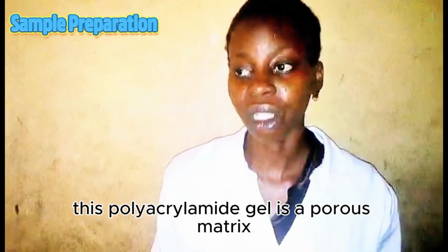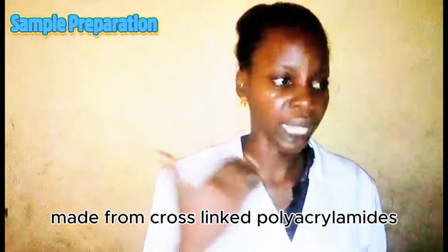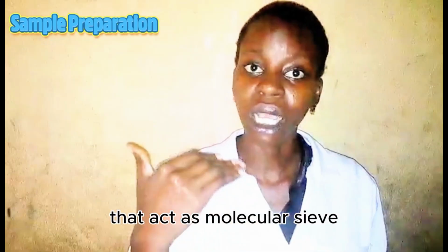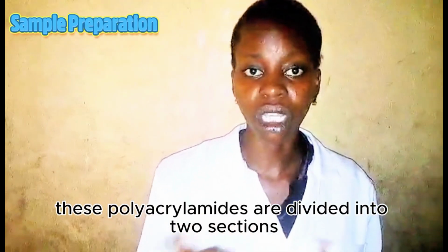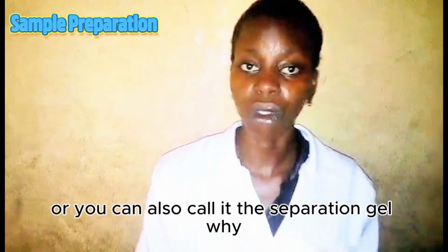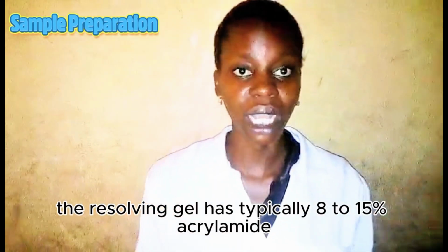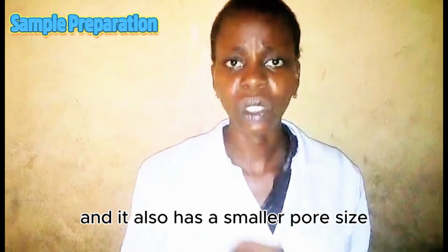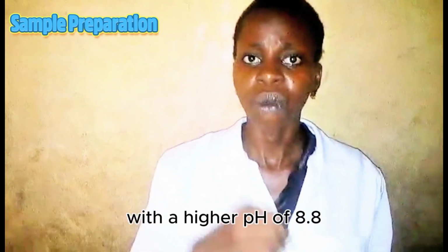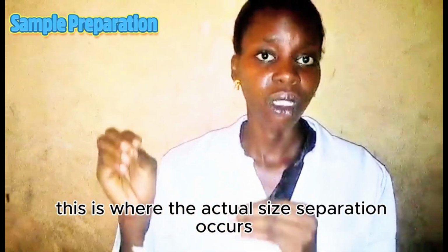This polyacrylamide gel is a porous matrix made from cross-linked polyacrylamides that acts as a molecular sieve. These polyacrylamides are divided into two sections. One, we have the resolving gel, or you can also call it the separation gel, while secondly, we have the stacking gel. The resolving gel typically has 8 to 15% acrylamide, and it also has a smaller pore size with a higher pH of 8.8. This is where the actual size separation occurs.